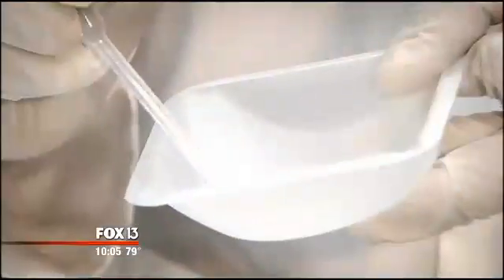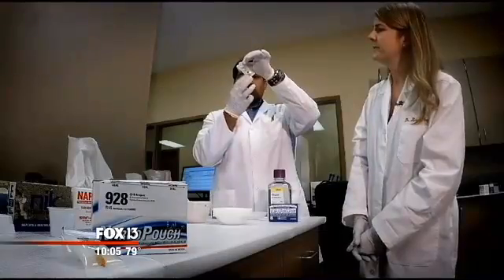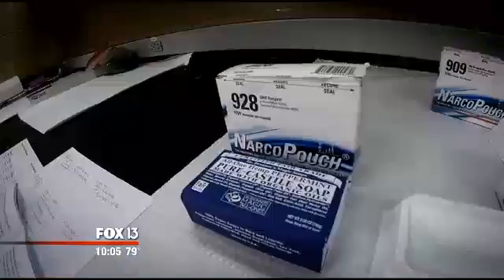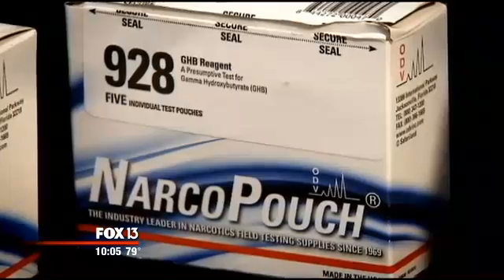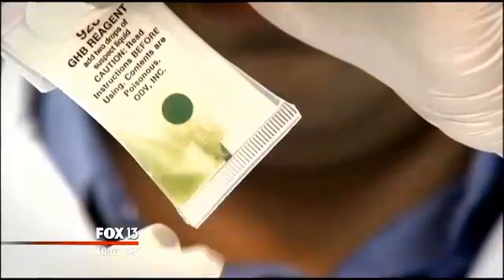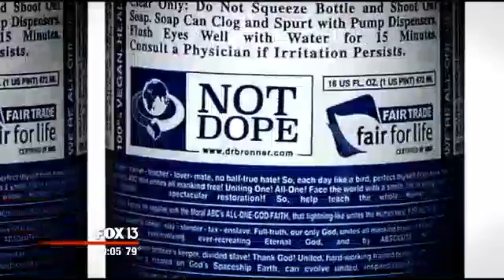From chocolate to soapy water from this natural bar of soap. Now we're adding that to the pouch. Dr. Hagen-Pay says the Narco Pouch tested positive for the date rape drug GHB. Punk rocker Don Bowles was arrested on drug charges in 2007 on the results of a field drug test called the Narco Pouch 928, which tested positive for GHB. The official state lab in California later confirmed it was soap, not dope.